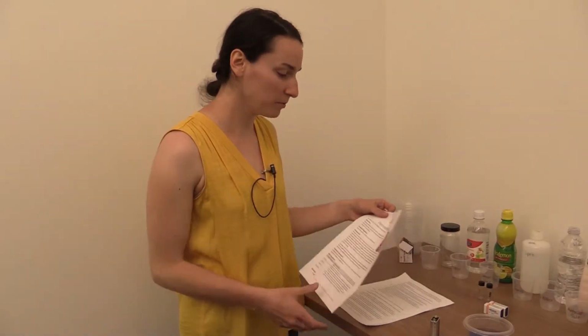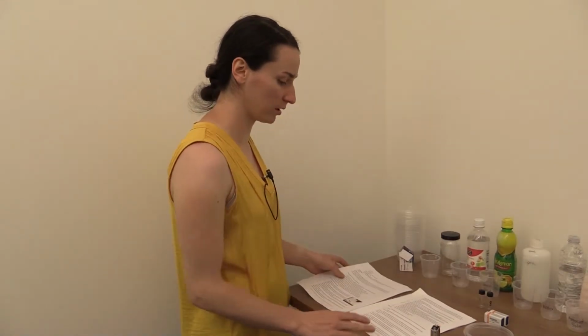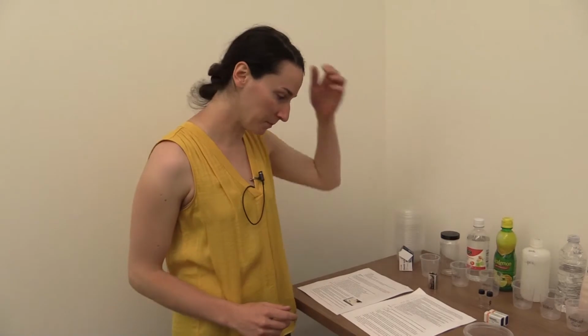Hey guys, today I'm going to be going over how to do the electrochemical chameleon lab. This one gave me a little bit of trouble and it's not very often done, so I wanted to give you guys the lessons I learned from doing this experiment.